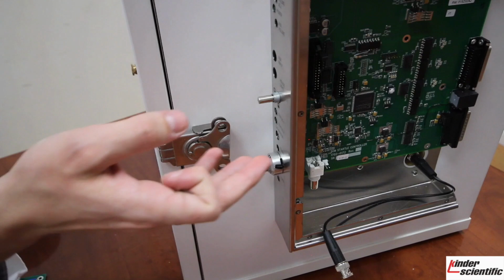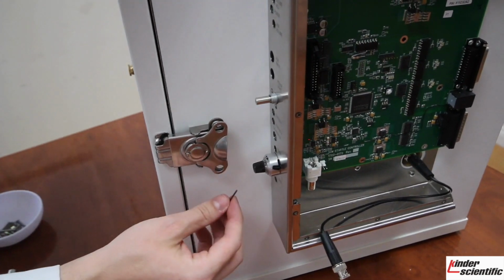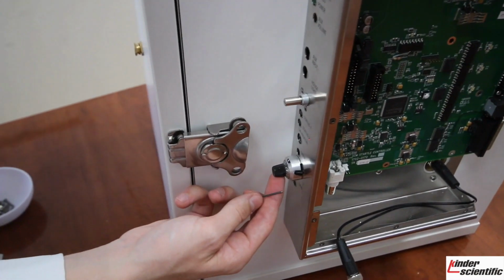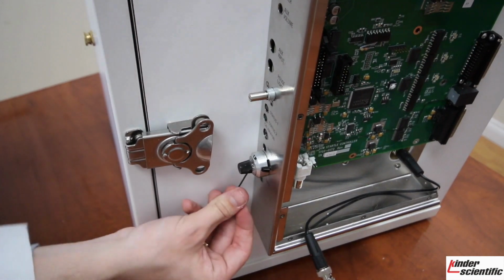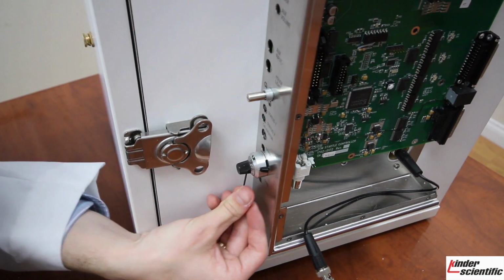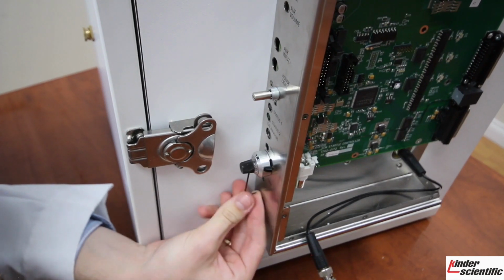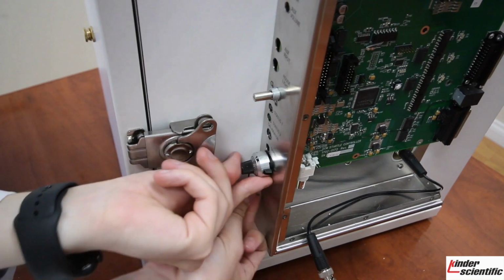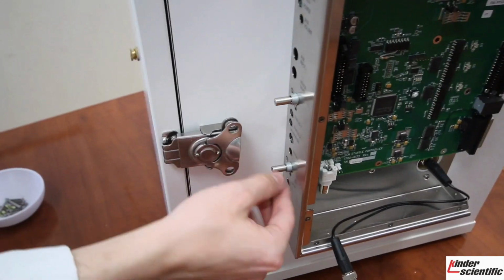The other part you will need to remove, other than the screws and the BNC cable, are the vernier dials. Unfortunately, we only had one in stock, but it's still able to show you how to remove it. So you just need the small Allen wrench, and located at the bottom is a small little hole that it can fit into that has a little set screw in it. So just go ahead, get that inserted. You just loosen that, lefty loosey, and you're able to just pull it right off of the potentiometer there.